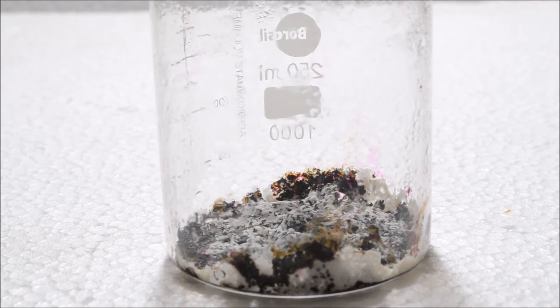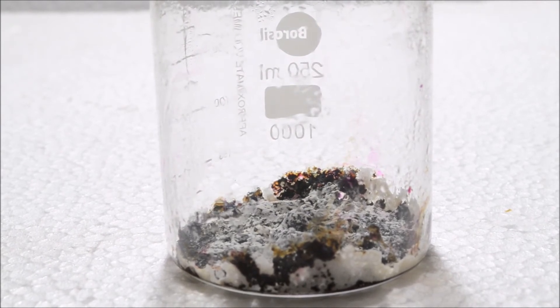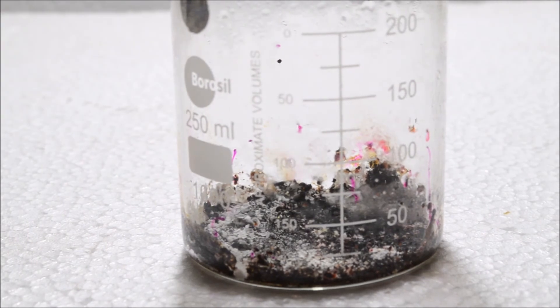After a few minutes, the reaction stops but as soon as some amount of water is added, the reaction starts again.